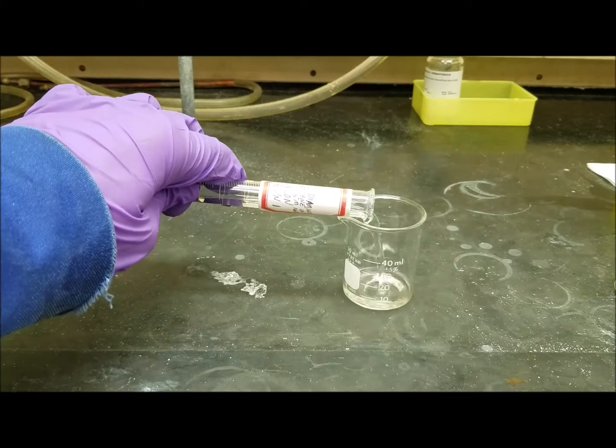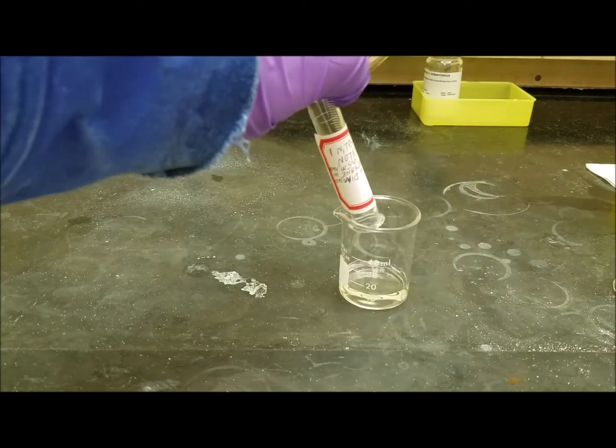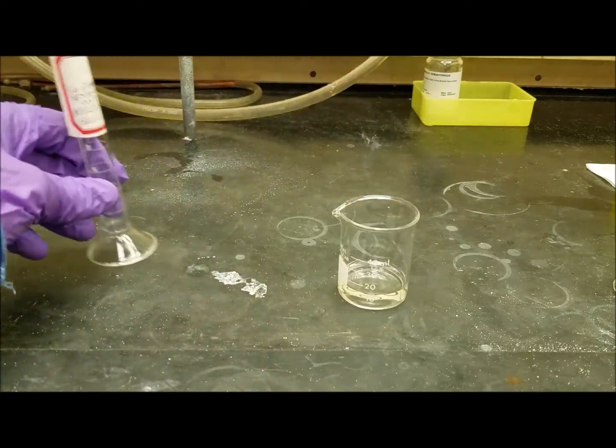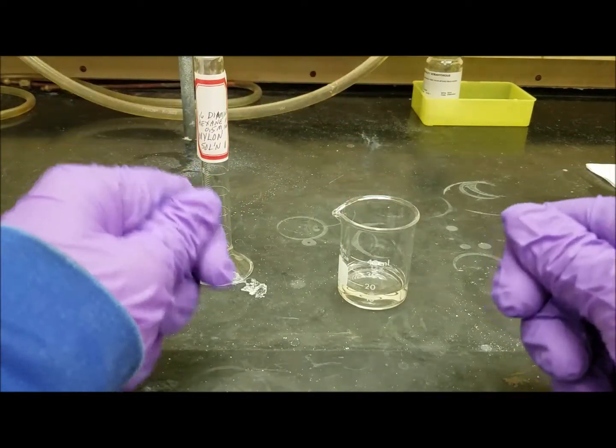So we're going to pour this into the beaker right here. So this has a diamine, NH2 groups on either end of the molecule.